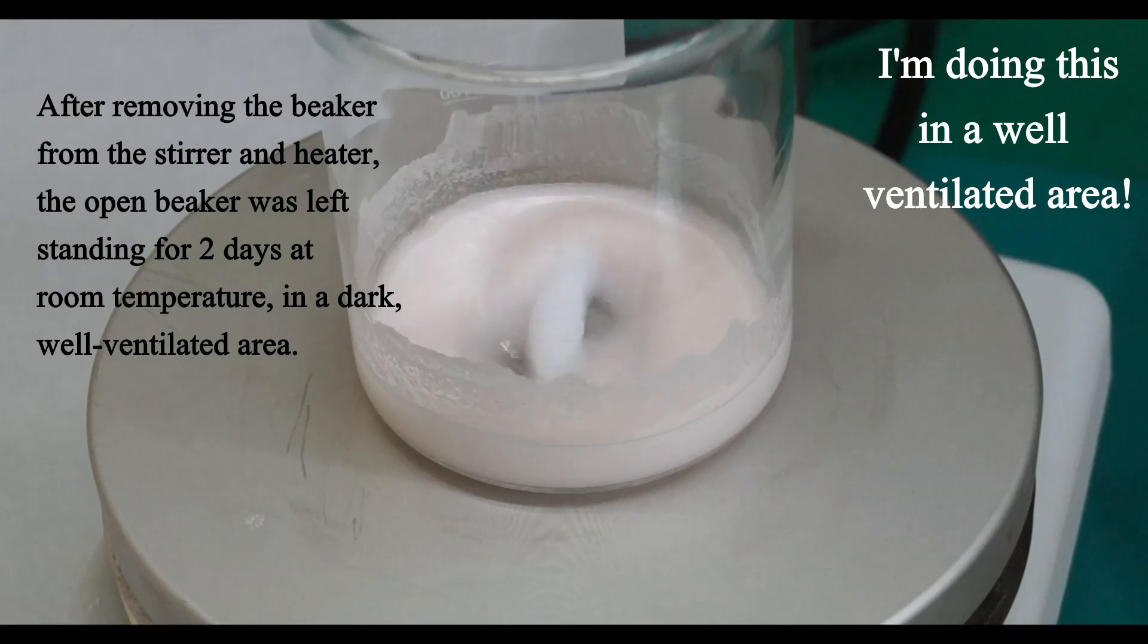I continued heating and stirring until the content of the beaker was only slightly wet with acetone. I then removed the beaker and let it stand for 2 days so that the last traces of acetone evaporated.